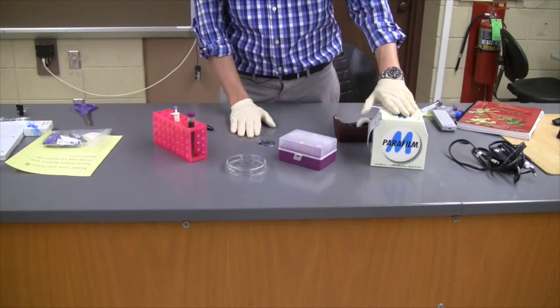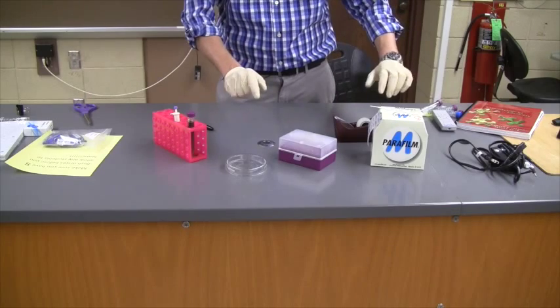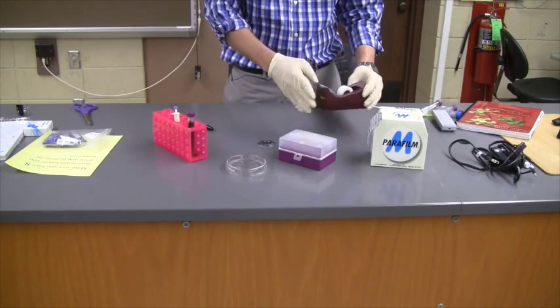I have some parafilm, which is a wax-like substance that we can use to seal up the plates. If we don't have this available in lab, we'll probably have scotch tape. We can use that too.